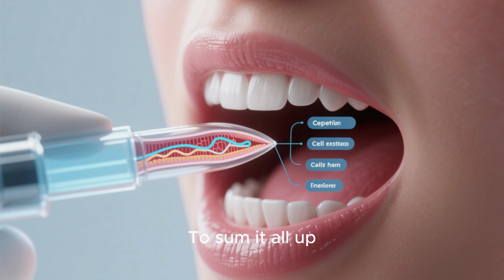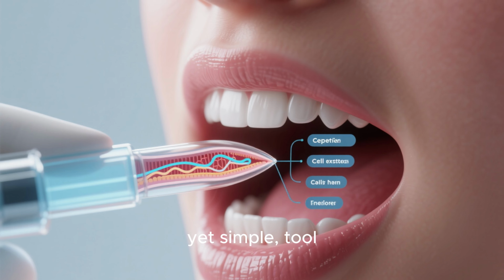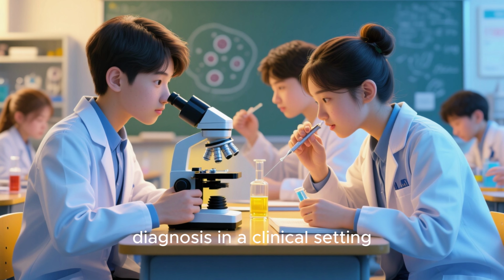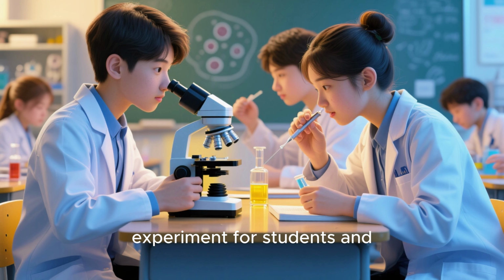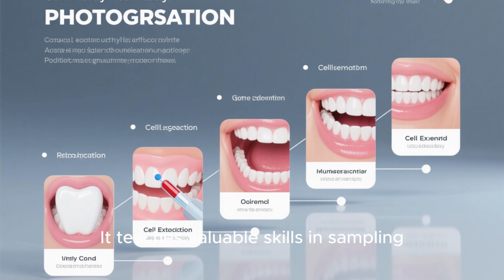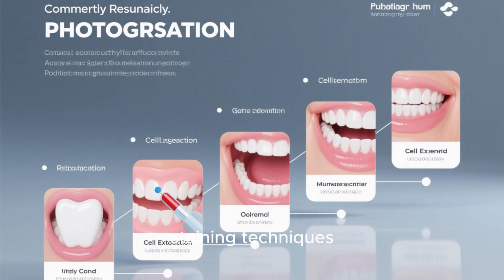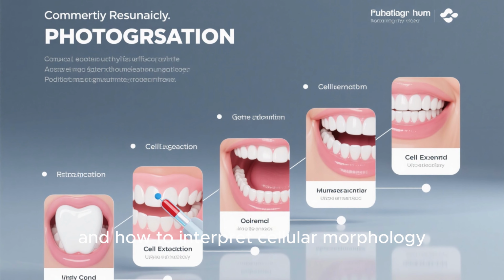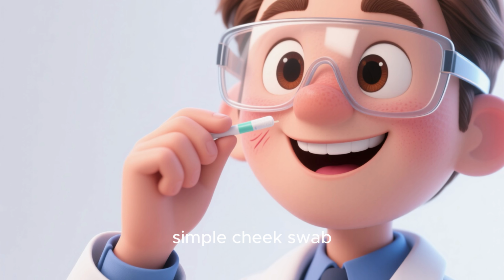To sum it all up, the oral cell examination is an incredibly powerful, yet simple, tool. It's vital for early diagnosis in a clinical setting, but it's also a fantastic educational experiment for students and researchers. It teaches valuable skills in sampling, microscopic preparation, staining techniques, and how to interpret cellular morphology. We hope this guide has shown you just how much you can learn from a simple cheek swab.